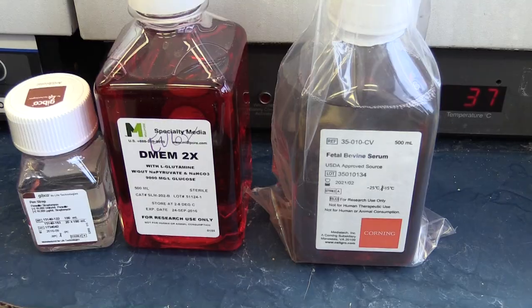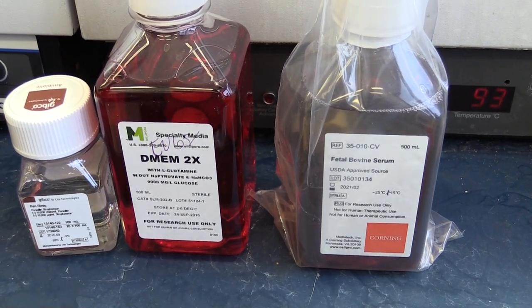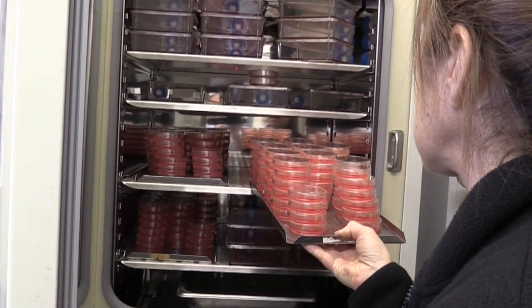While this is happening, we prepare the overlay medium. Cells are usually grown in a liquid nutrient medium that contains a variety of salts and vitamins, amino acids, glucose, and we also supplement it with animal serum, which contains growth factors for the cells. The red color is due to the presence of a pH indicator — it turns yellow when the medium is acidic, and purple when the medium is alkaline.